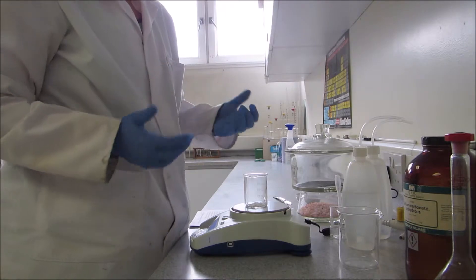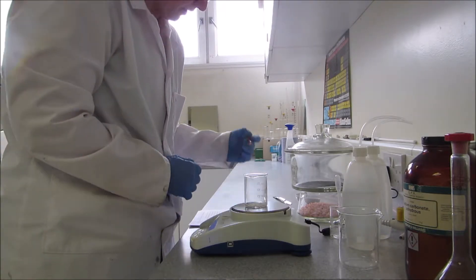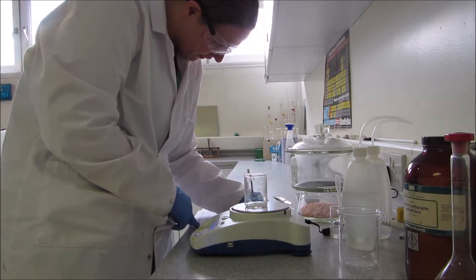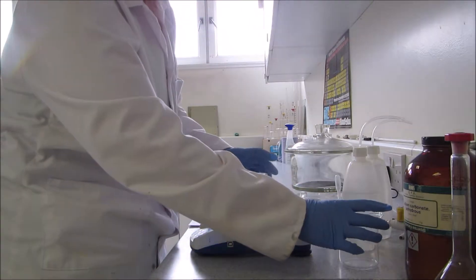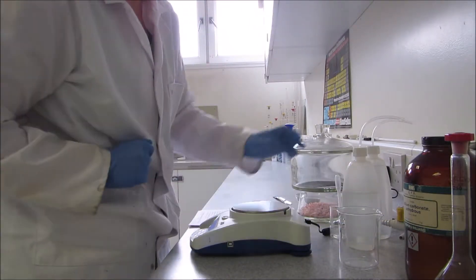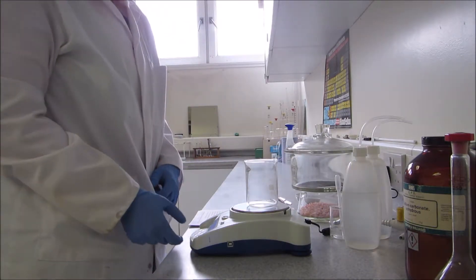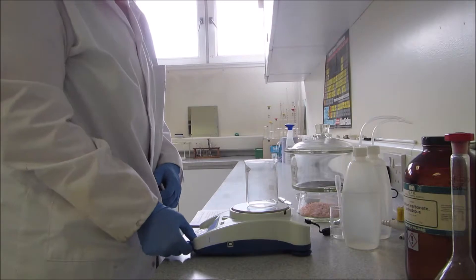Each piece of apparatus has a slight difference in its weight, so I've recorded that in my small beaker: 1.20 grams. I'm now going to put that to the side and lift this larger beaker and put it on, and again I'm going to tare it.